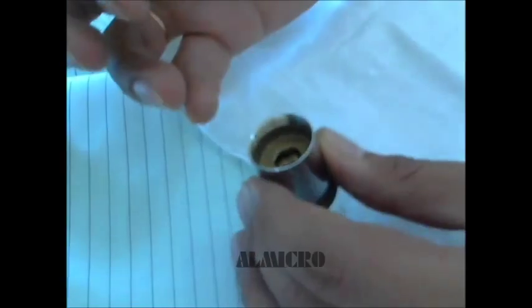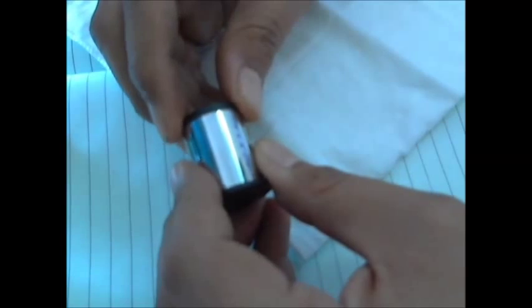From the other part, you can also remove this lens as well — very easy. This lens also, with the same cloth, you take and clean it up. The other side also — give it a good thorough cleaning. Now with the clean cloth, it looks very clean. Just put it back, take care that you match the threads, and tighten it up.